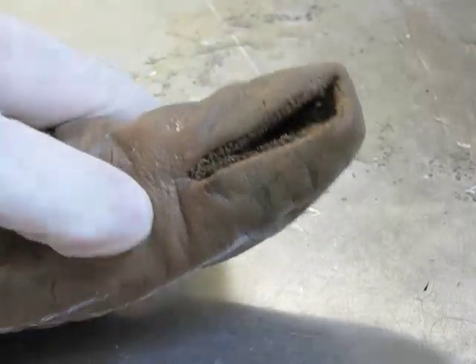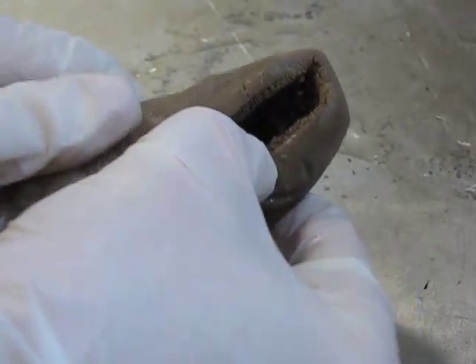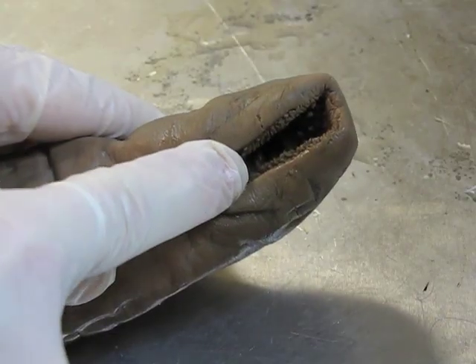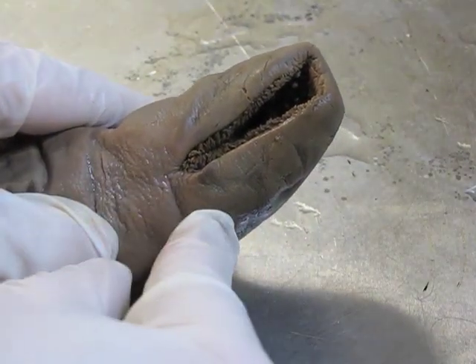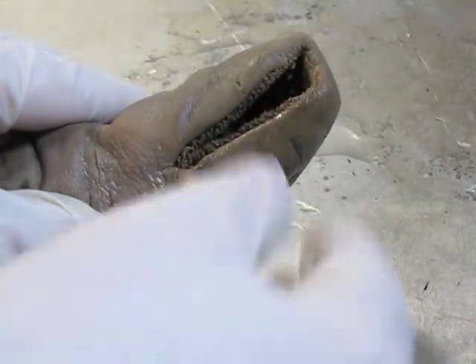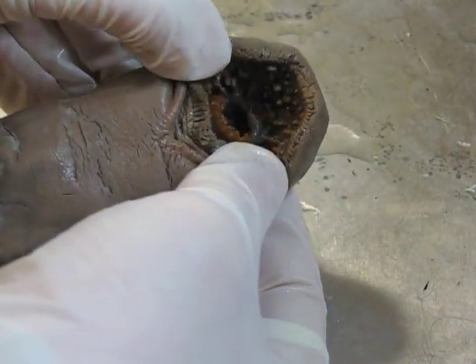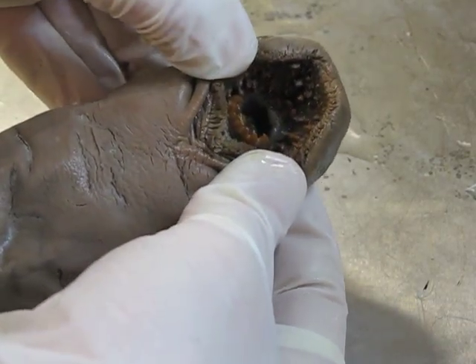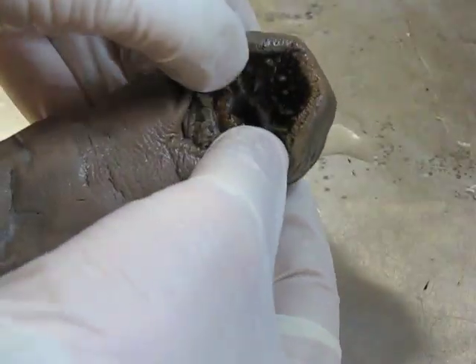These animals are actually parasitic. They use this strange mouth — round and suction-shaped — to latch onto the sides of larger animals and feed off the body fluids of their hosts. How do they get at the food with what looks like a wimpy little mouth? I'm going to open this up to look at the teeth inside. The mouth is actually quite fierce, and in just a second I'll show you a sectioned specimen to get a better look at those teeth.